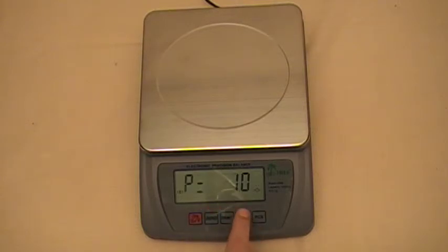That's going to bring up a menu asking how many pieces you're going to use to average the weight. The best way to do it is to use as many pieces as you can, so we're going to bring it up to 100.